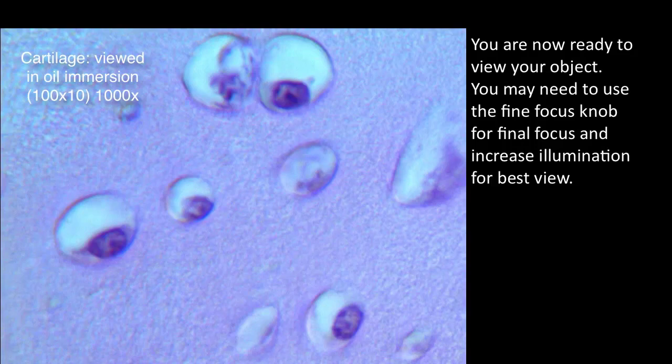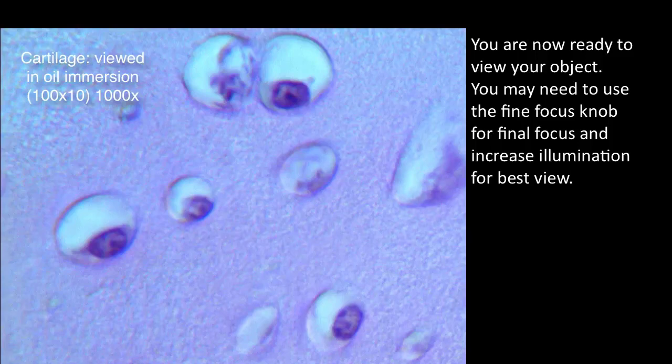You are now ready to view your object. You may need to use the fine focus knob for final focus and increase illumination for best view.